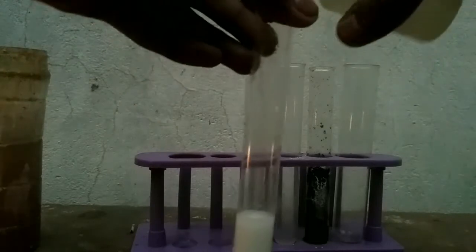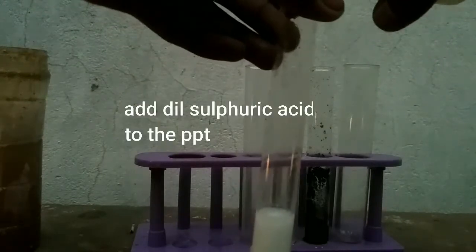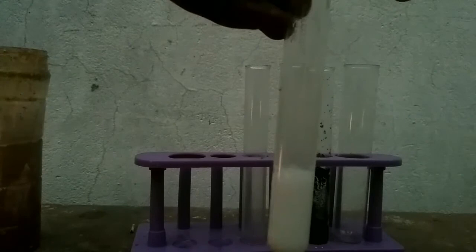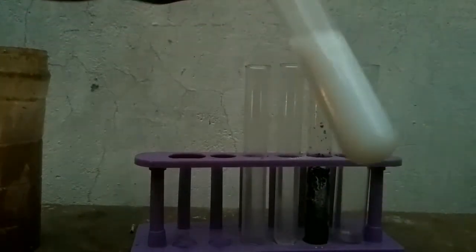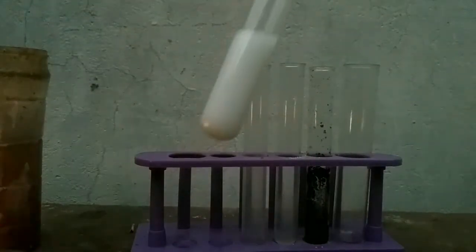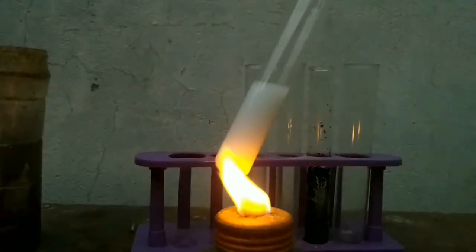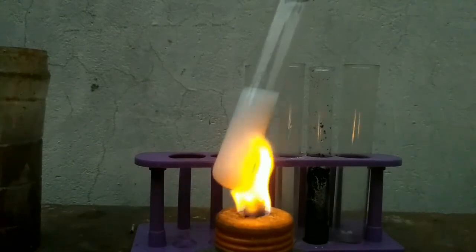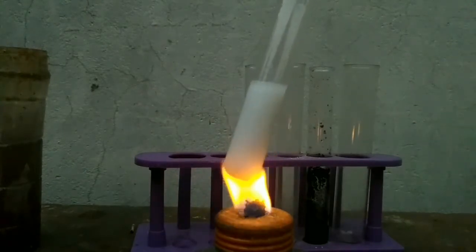Dissolve the precipitate in dilute H₂SO₄. Heat the contents.